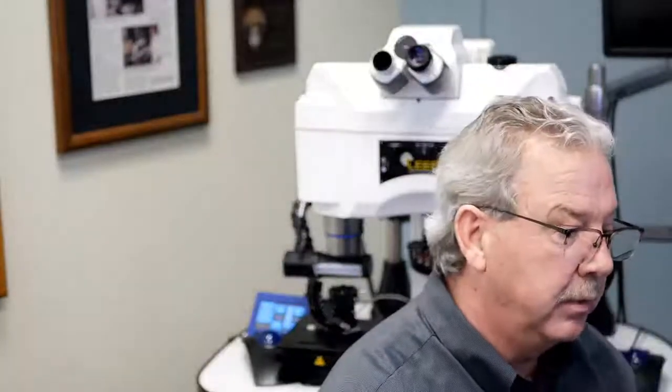Some of our competitors do have multiple eyepieces available, and one way to reduce the cost of your quote, and most customers won't notice the difference at quoting time, is to quote you a smaller field of view eyepiece. An 18mm field of view eyepiece is typically considerably less expensive than a 22 or a 23mm eyepiece. That's because you've got to provide supportive optics to make this all work. It's not as simple as just making that ring inside the eyepiece bigger. We have to change the whole optical design to be able to do that.